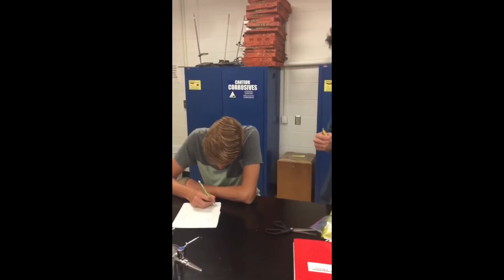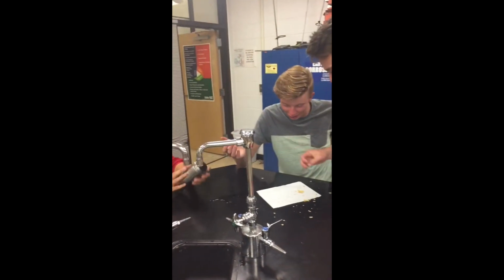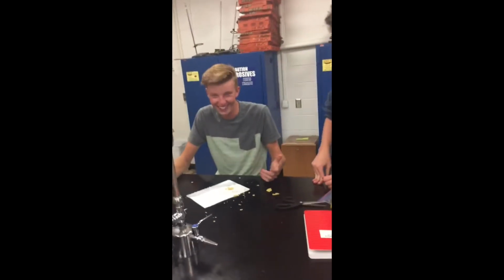This is an example of something not to do when in the lab room. Hey man, that's not good, oh no, hey. This is what you should do instead. Go.